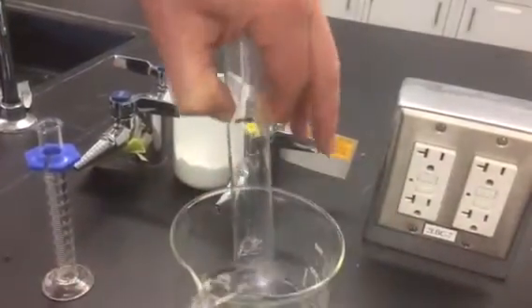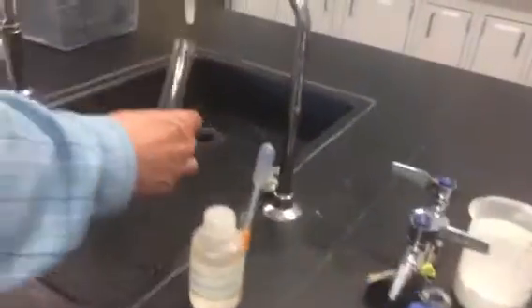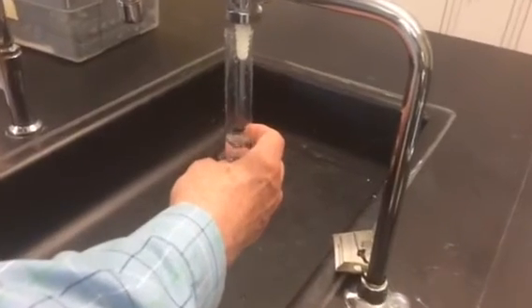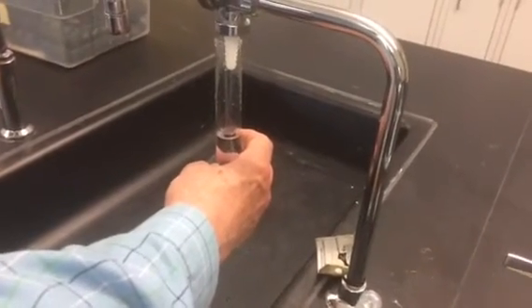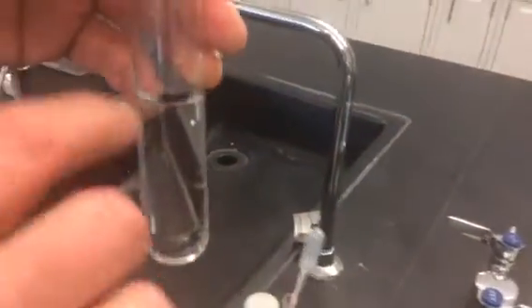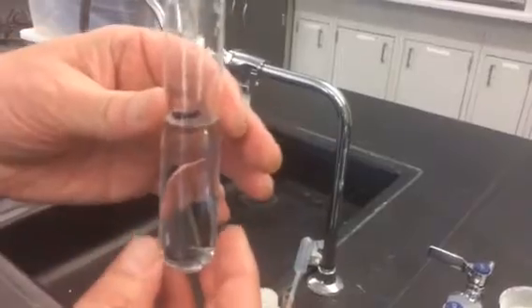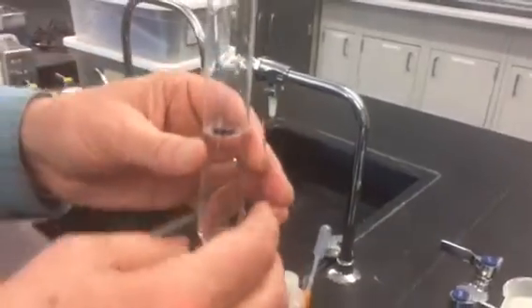And then I can easily fill up the test tube to my mark. And then using a suitable graduated cylinder, figure out what the volume of liquid is, which is the same of course as the volume of the gas.